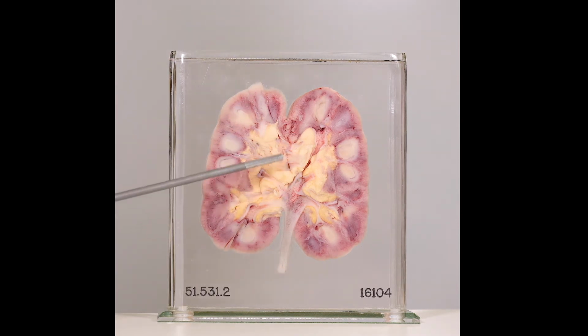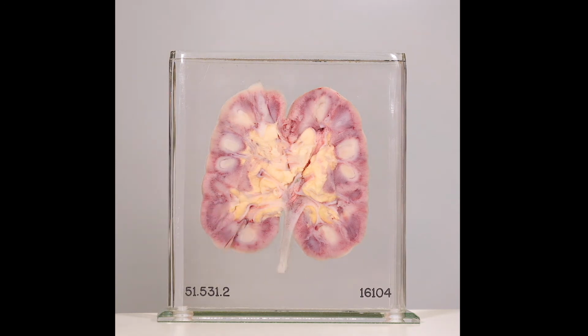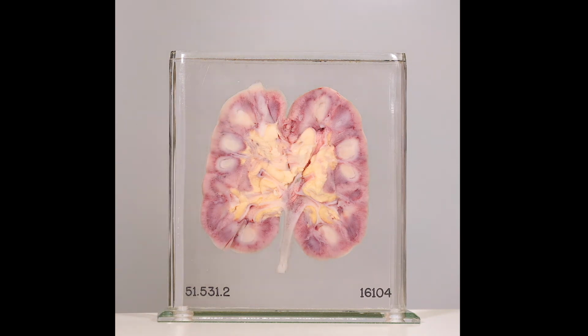The renal pelvis, this area here and here, calyces, these small white regions here, and upper ureter here have also been opened. The cortex is of reasonable width throughout, and the junction between the cortex and the medulla here is clearly demarcated. However, areas of congestion in the renal pelvis here and ureteric mucosa are indicative of acute inflammation.